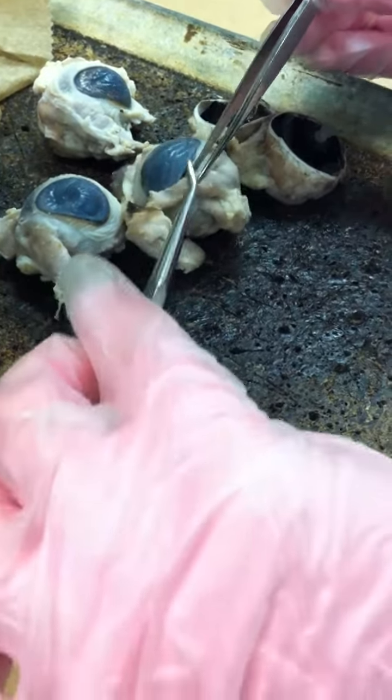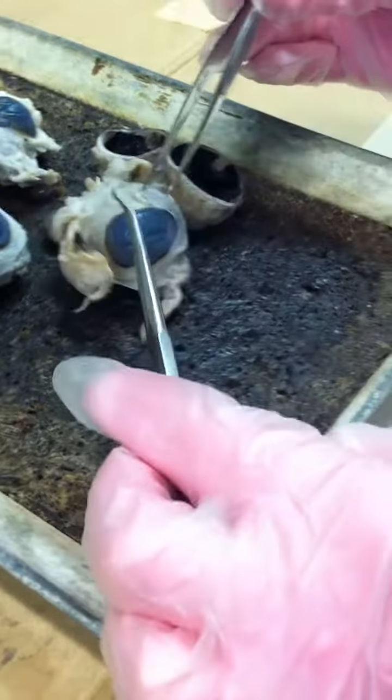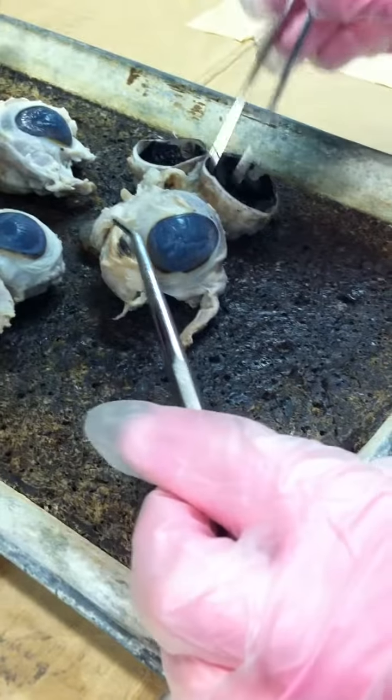So if you move this oblique. Oh, this one actually had the inferior rectus. Inferior rectus, yeah. The one that is missing in most eyes is the superior oblique. That's the one that you won't get.